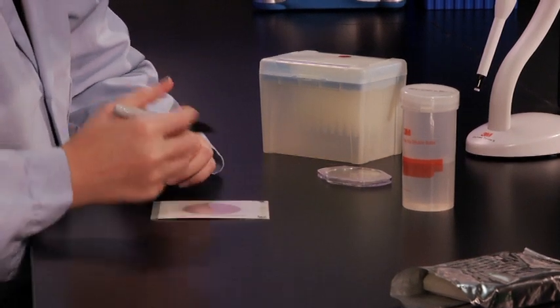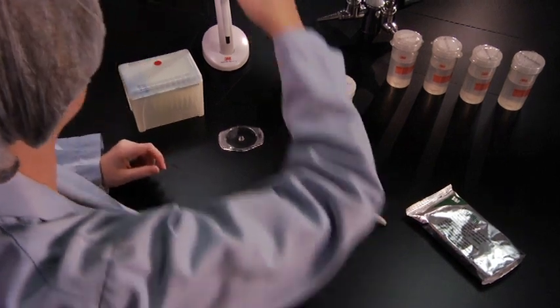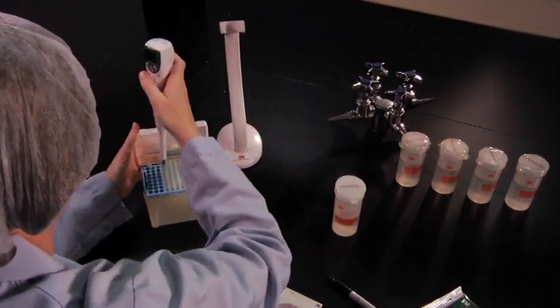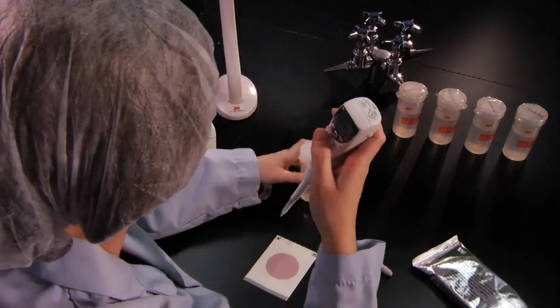Then, attach a tip to your pipetter. We're demonstrating with 3M's 1 mL electronic pipetter and tips, a pre-programmed instrument for diluting and pipetting onto 3M PetriFilm plates.